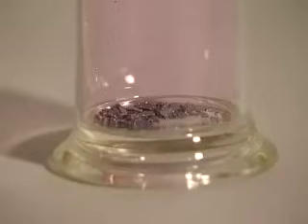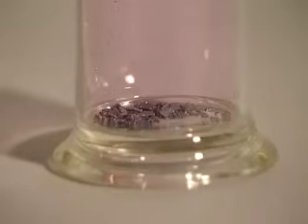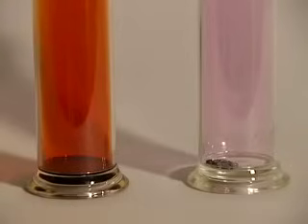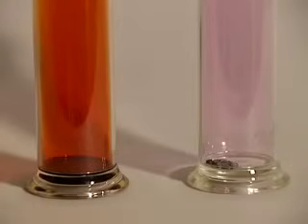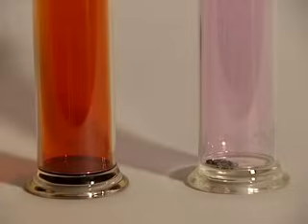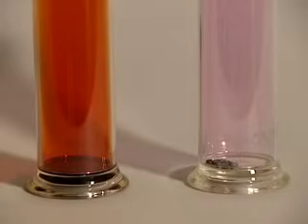Fluorine and Chlorine are both gases at room temperature. But Bromine is a liquid, and Iodine is a solid. Even so, they're both quite volatile. You can see the coloured vapours — orange-red above the liquid Bromine, and purple above the solid Iodine.